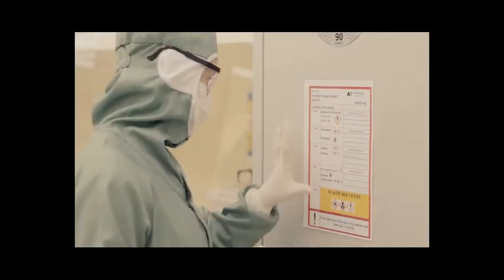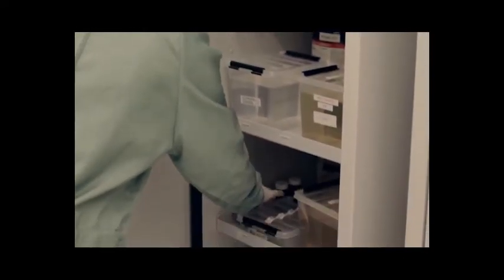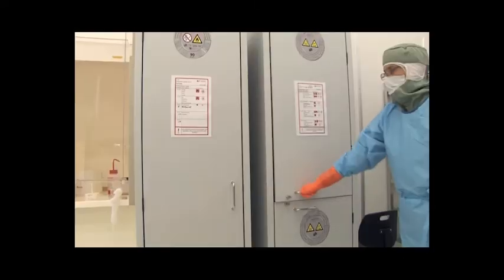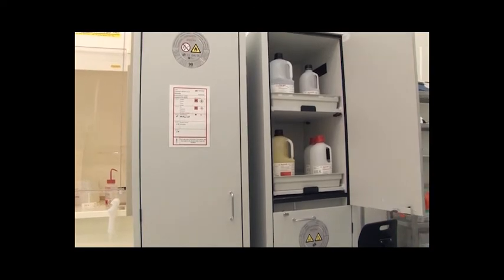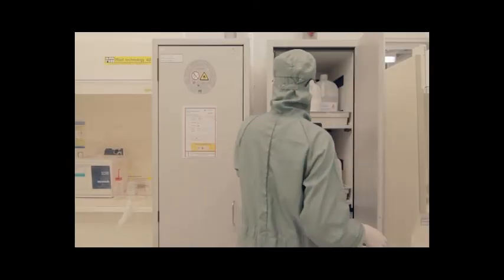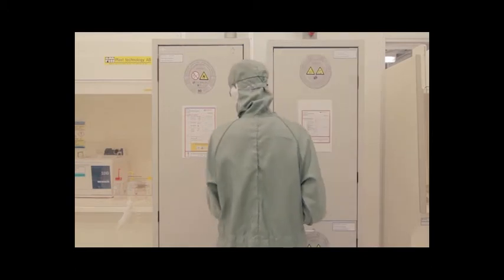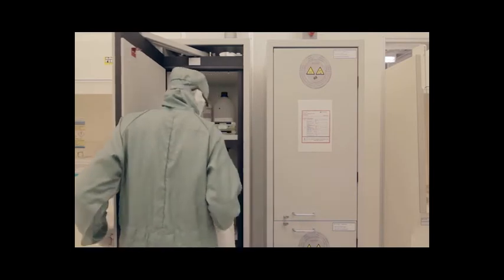In the Perspex cabinets, the name of approved solvents are marked on each shelf. If you have a new chemical to store, follow instructions of how to add it to the chemical list. If in doubt, ask the chemical responsible person. The buffer stock is the primary place of storage. In the F12 bay, there are additional fire safety cabinets. Solvents and acids can react very violently with each other. For safety reasons, never place solvents in acid cabinets or acids in solvent cabinets.